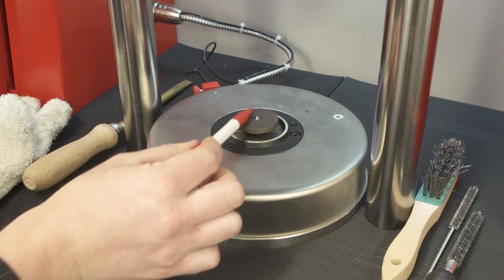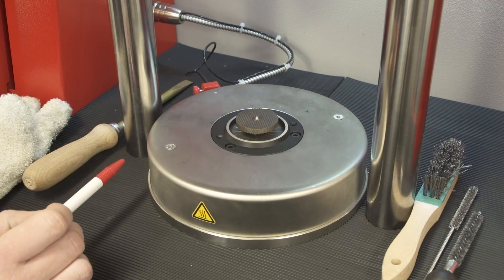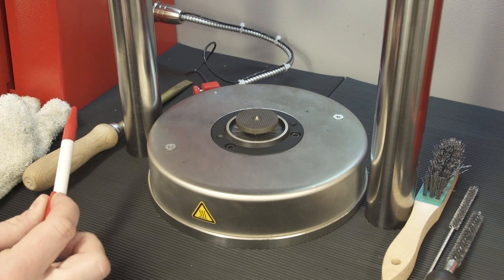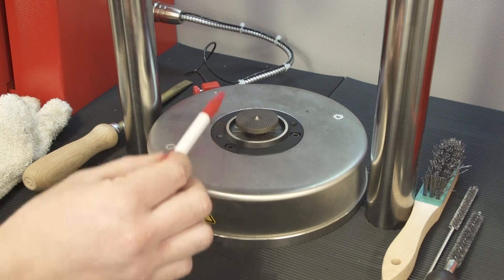The rotor has a serrated design in order to properly transfer the torque to the torque measurement system attached to the rotor shaft.